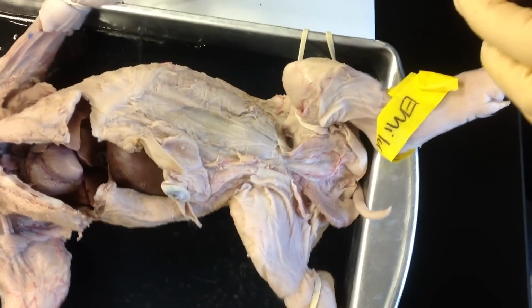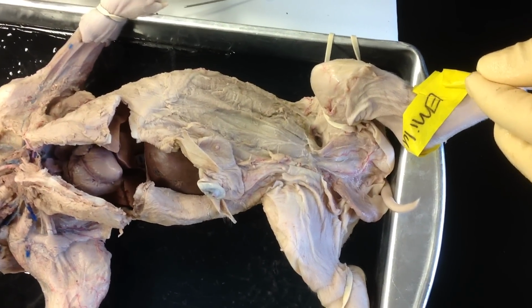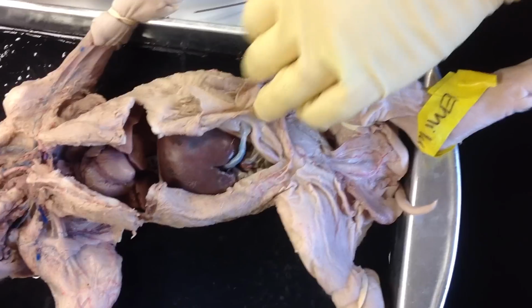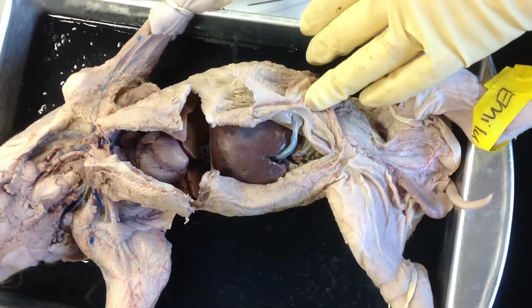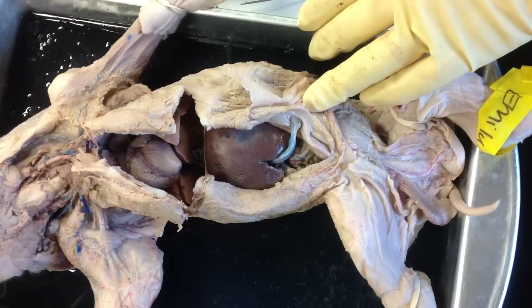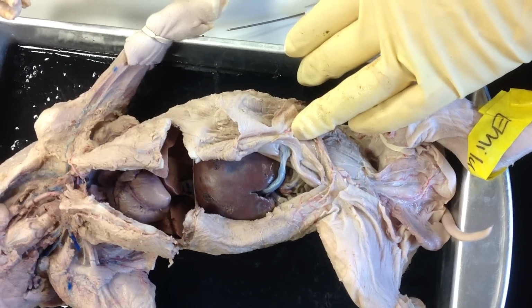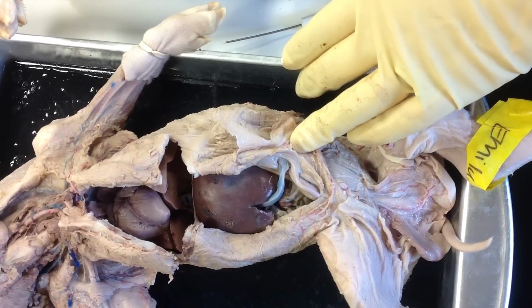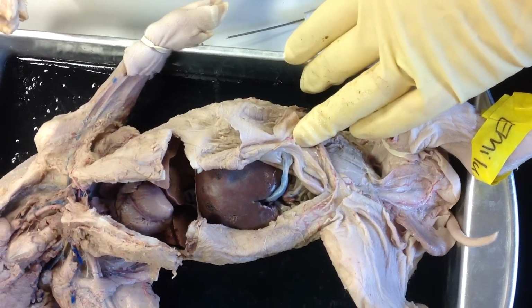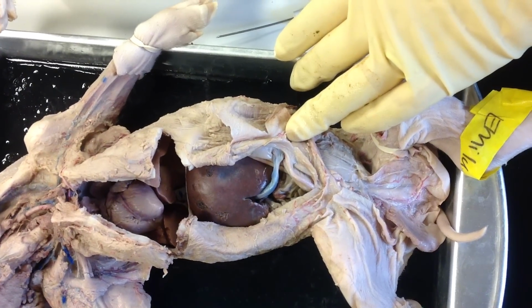Let's see. I think that is it. We've talked about the kidney before. I haven't gone over that with you, and I'm not going to dissect it out here, but there's a series of words that you have to be familiar with in the kidney, and that is the renal artery, renal cortex, medulla, pelvis, pyramid, and renal vein. Again, renal artery and vein should be easy, red and blue, right? And I think that's it.